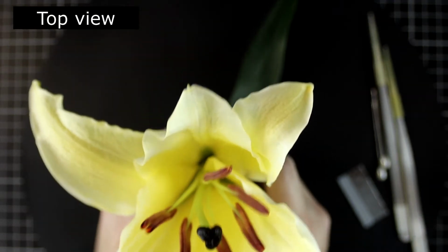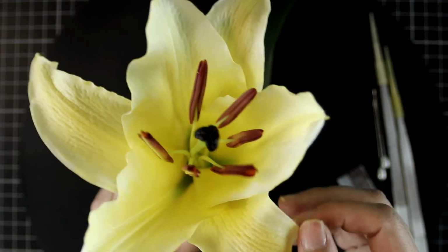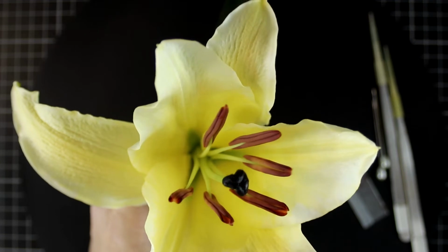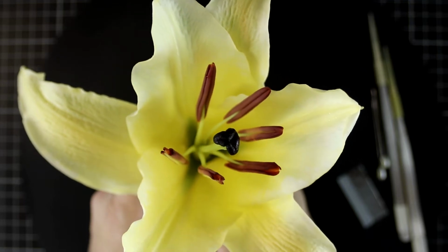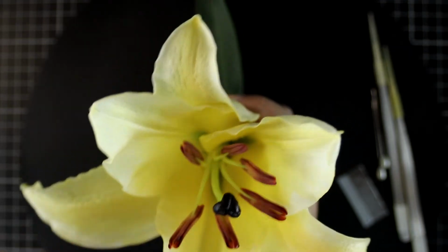So imagine that you are a pollinator. If you look at this flower, does it give you any particular information about whether you should go in this way or that way? It seems that it doesn't give you any directional clue. And you can also look for the symmetry.